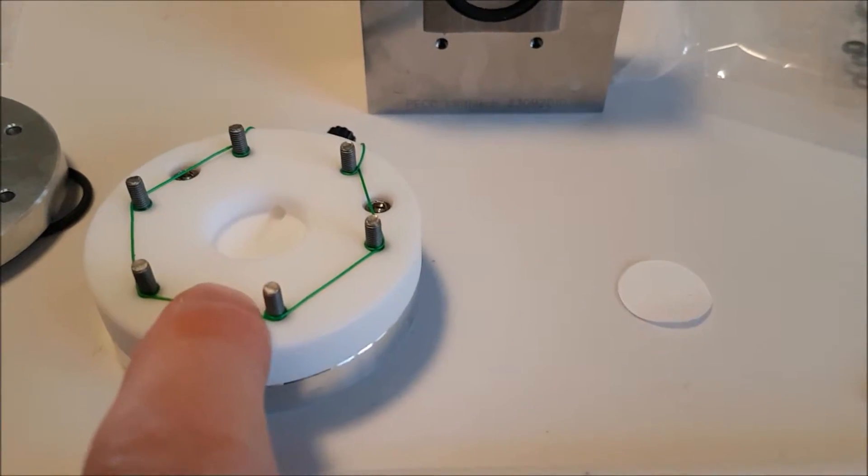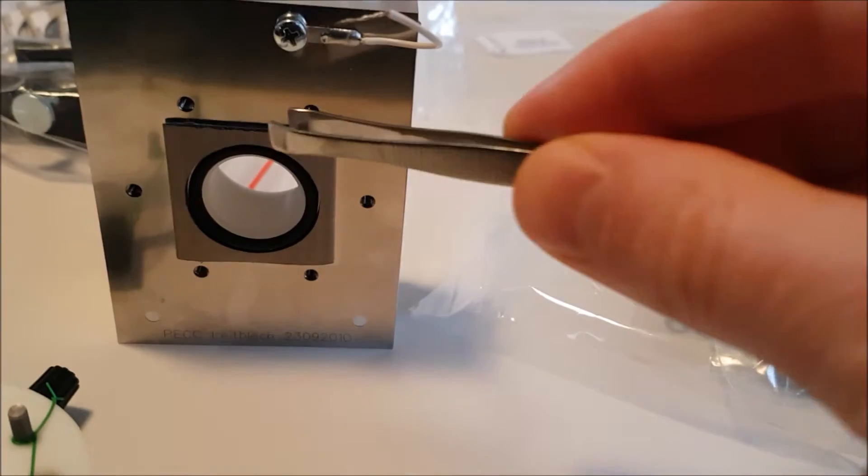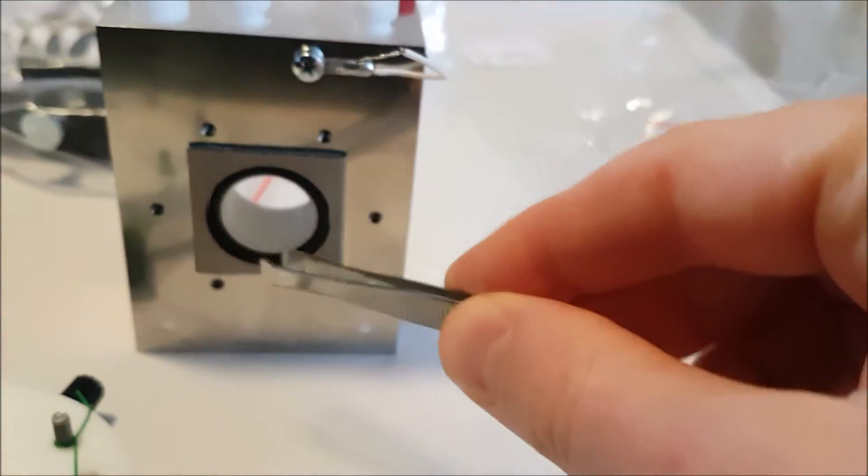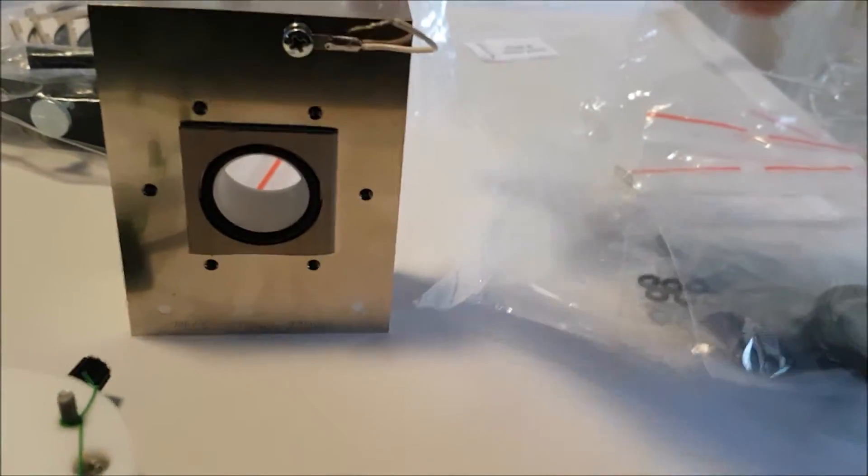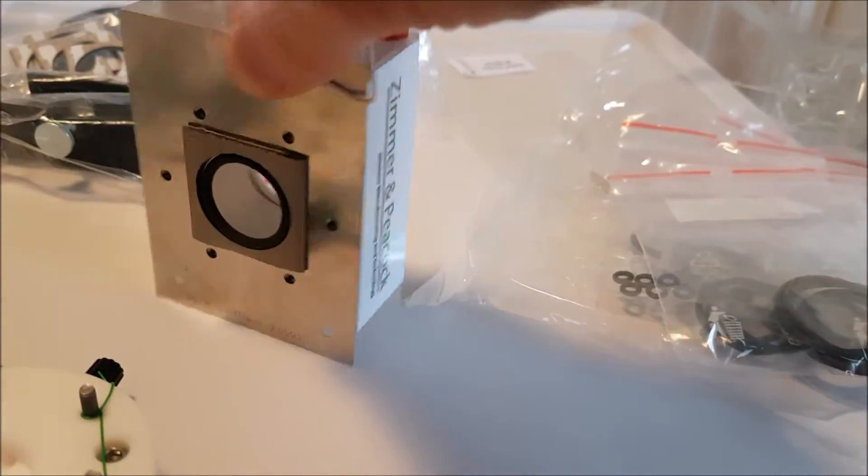There's actually another backplate that fits onto the cell. So this is the cell and I've taken off the plate here, and on one side there's the window with platinum in it.